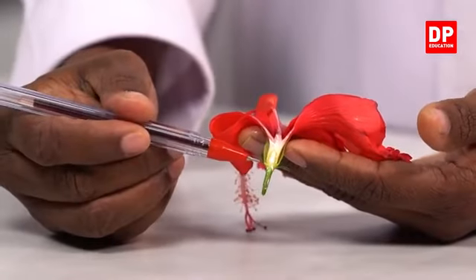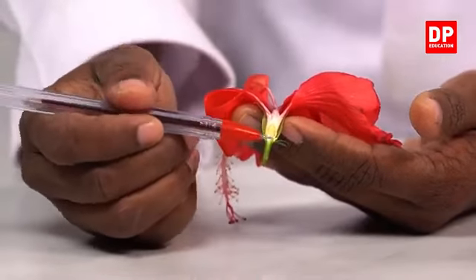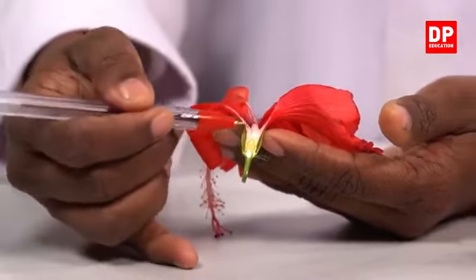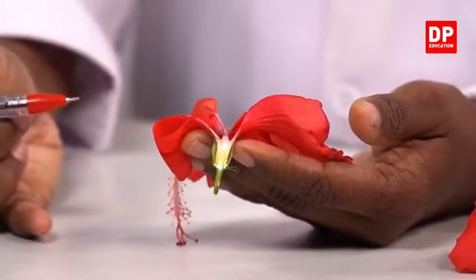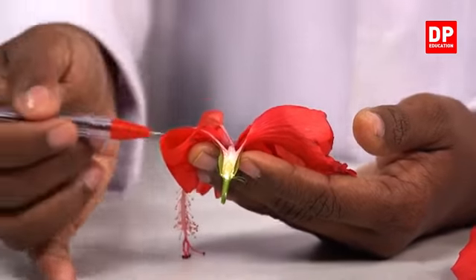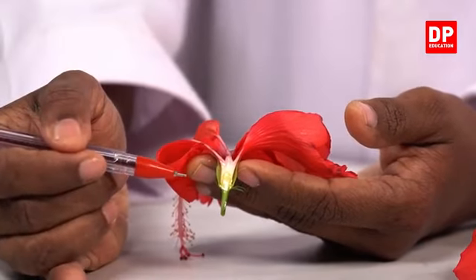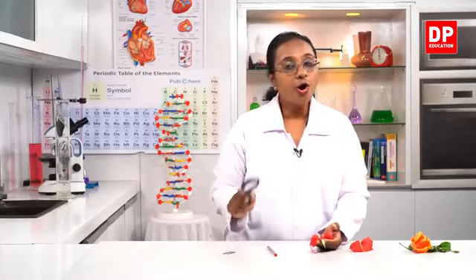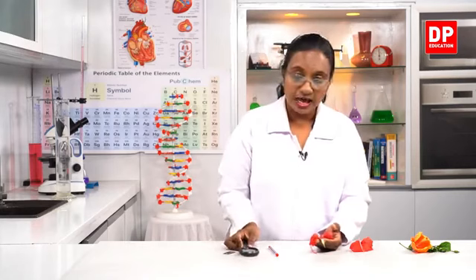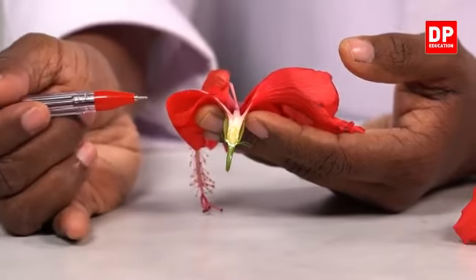So here you can see students, this is the stalk that attaches the flower to the branch. Then here we have the green color sepals, in a whorl arrangement. Then inside we can see the part that is part of the gynoecium or the pistil, the female reproductive structure. This is the ovary, you can see here. Inside the ovary you will be able to see the ovule. So students, when you are observing the flower, you can use the hand lens and observe it more clearly. But for now, I will show you the flower only. So here you can see students, the ovary with the ovules inside.